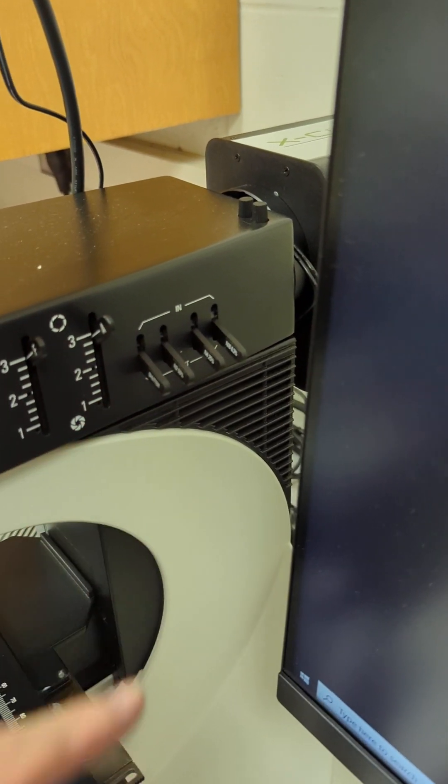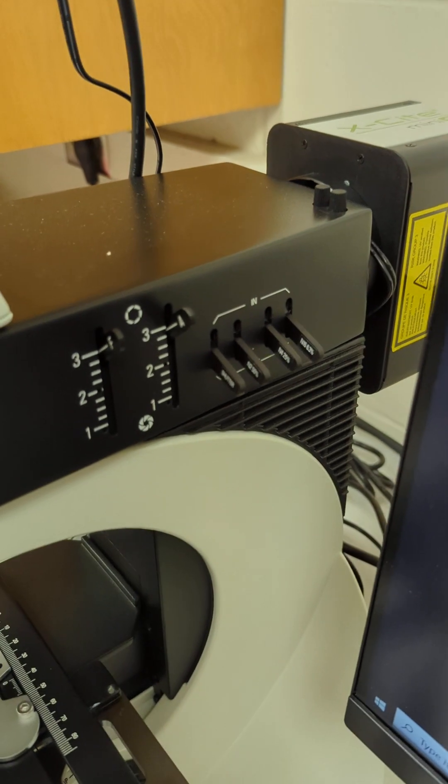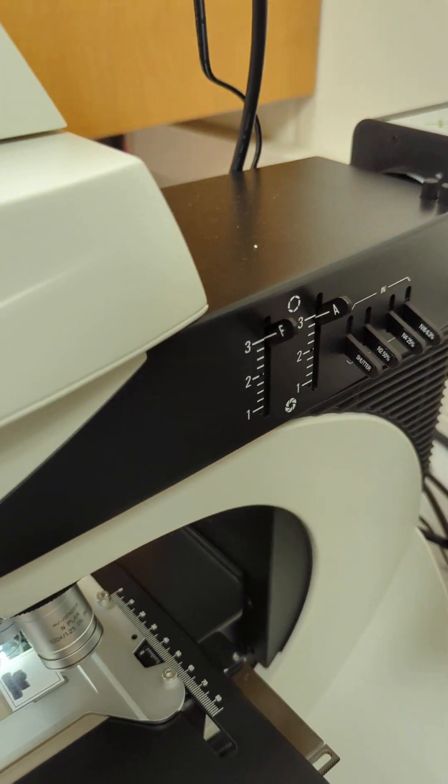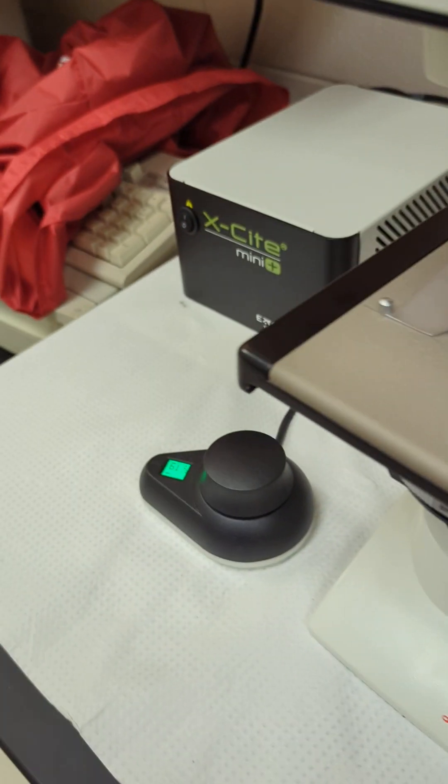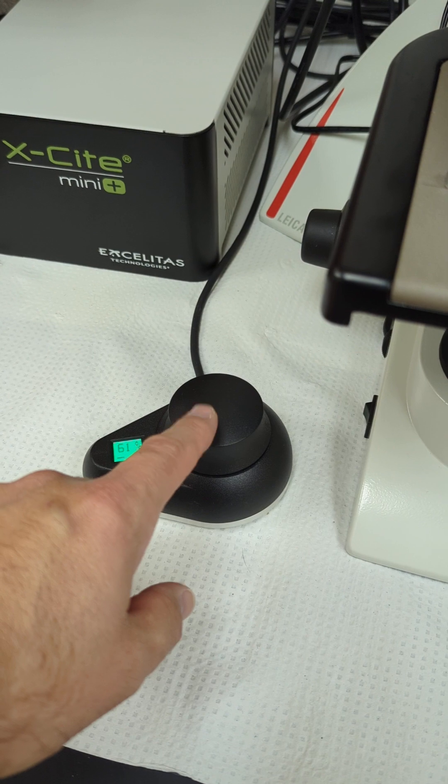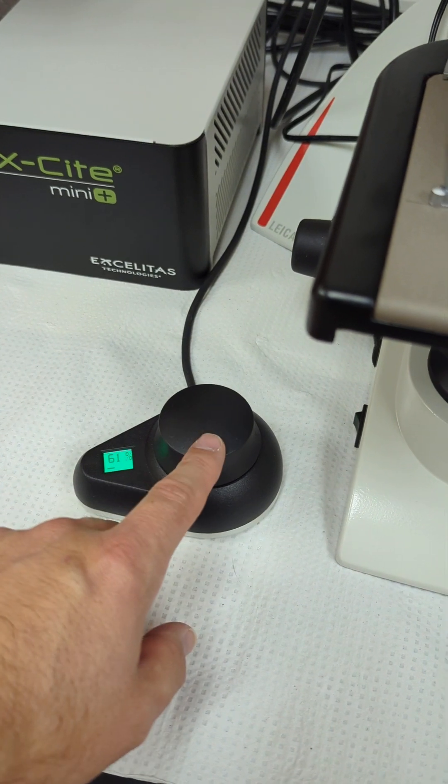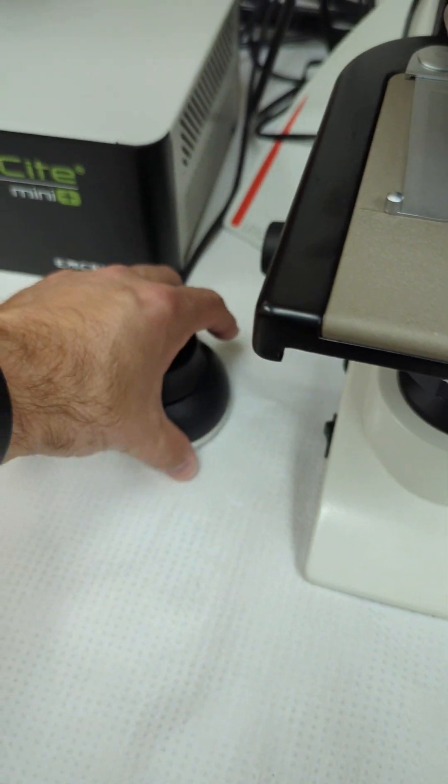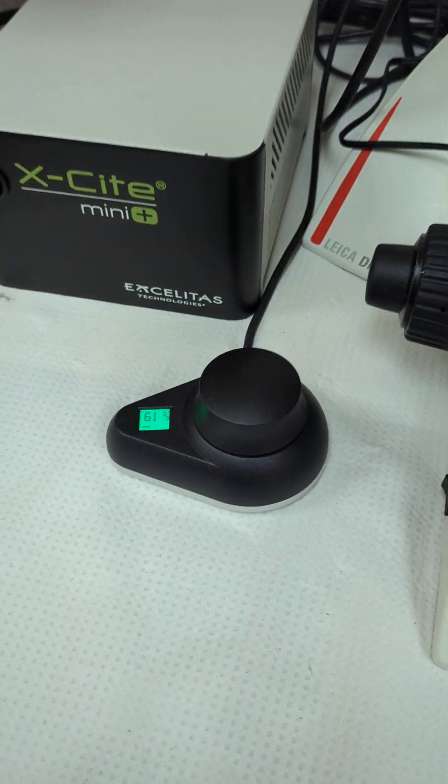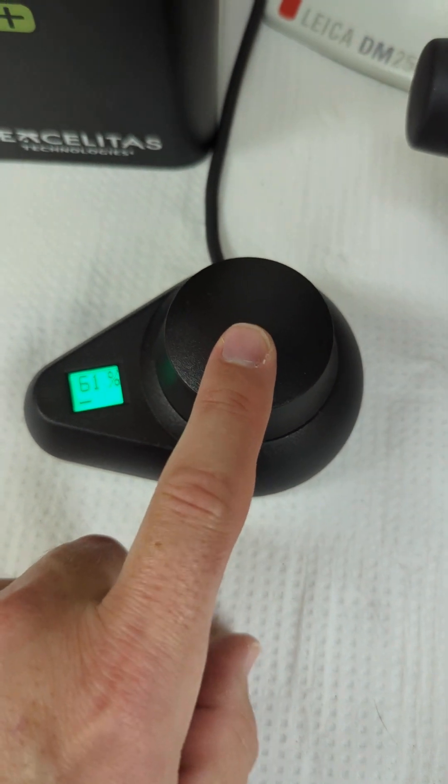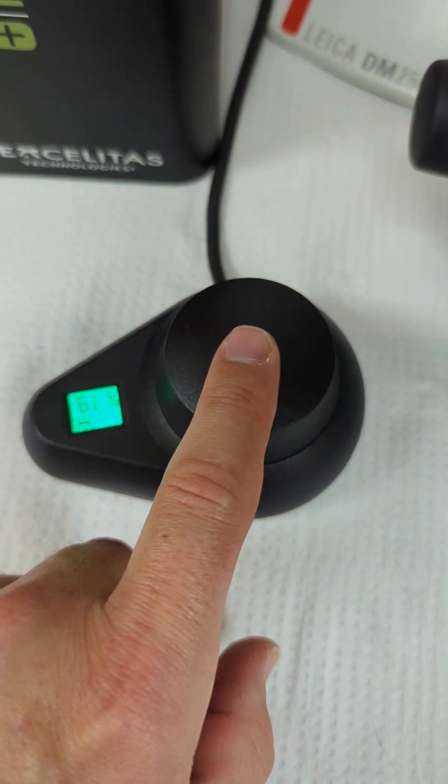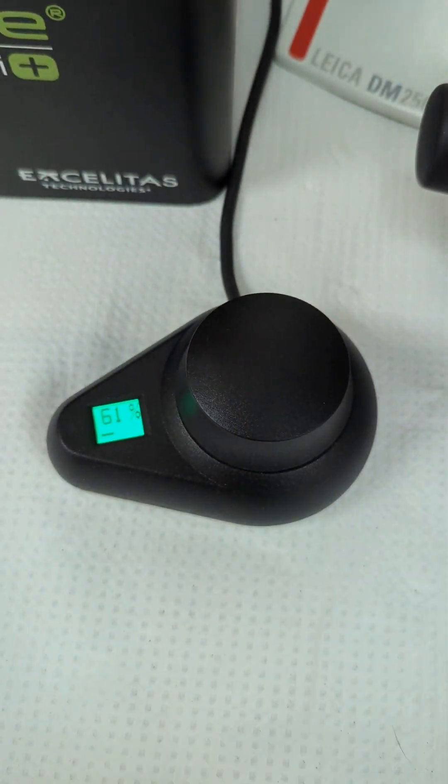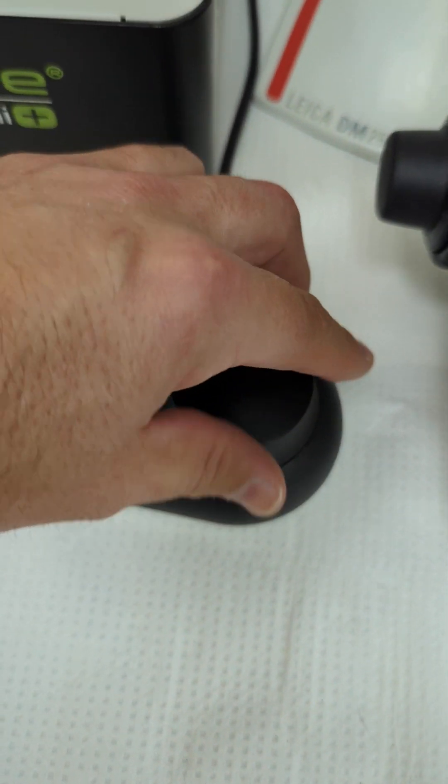What you have is a shutter. You can just flip that switch. Most likely you'll never use these because you have a really good light source that has everything built into this little handle thing. So this again is your shutter on, shut it off, and then your intensity.